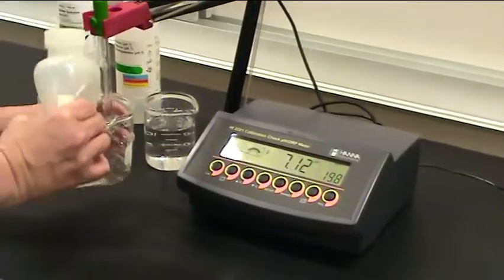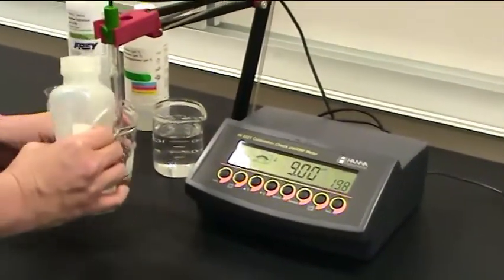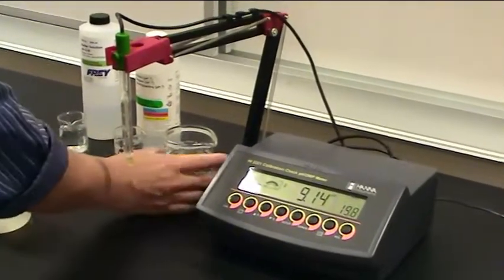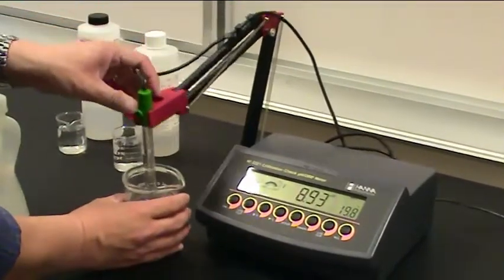To finish off, remember to rinse your probe and then return it to the storage solution for the next reading. All right.